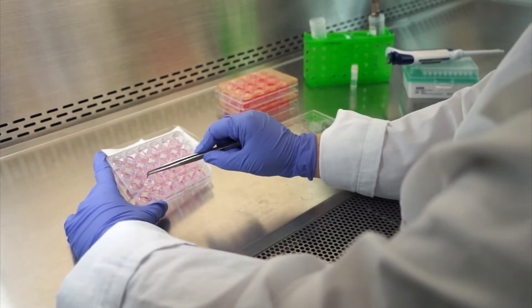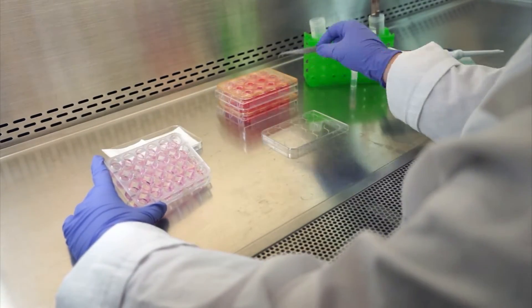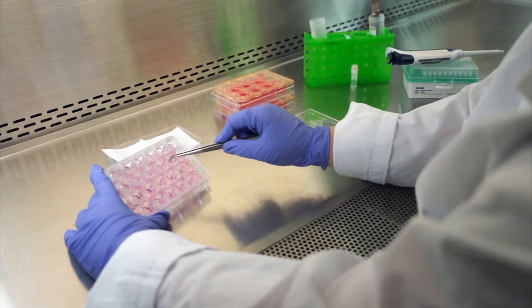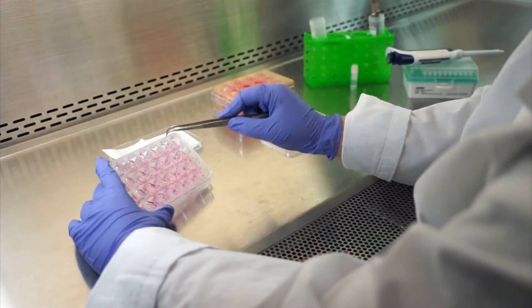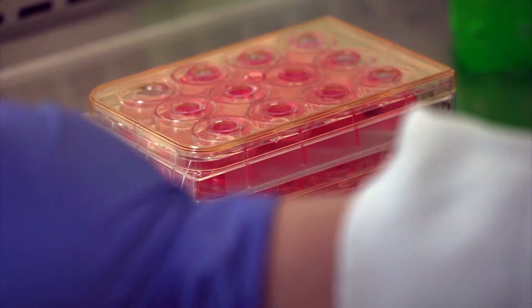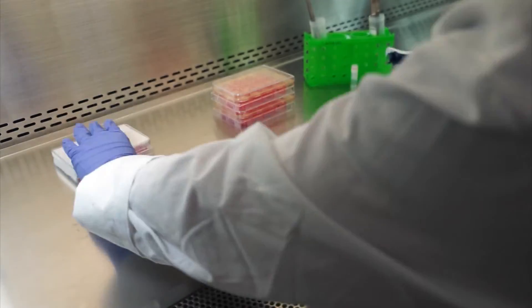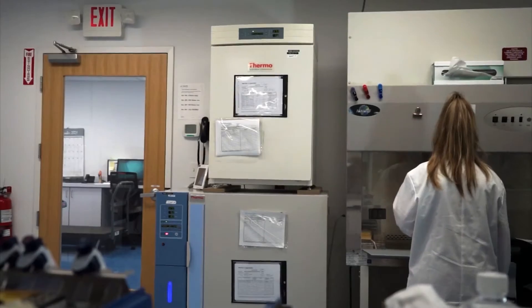Under sterile conditions using forceps, the tissues are gently removed from the agarose and dabbed on the gauze to remove any residual agarose from the tissues. The inserts are then transferred into the plates prepared with media and incubated overnight to equilibrate.